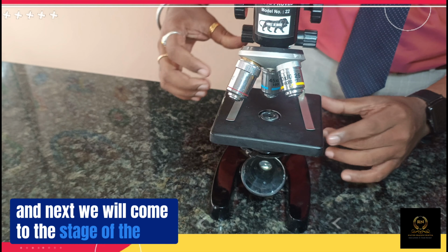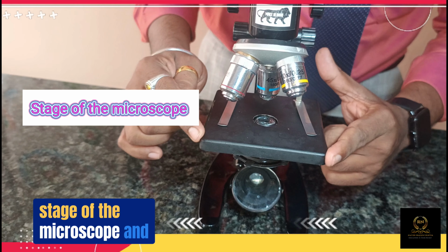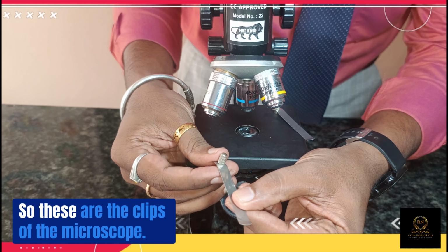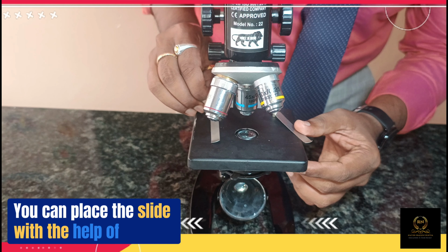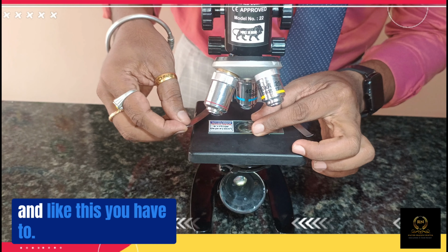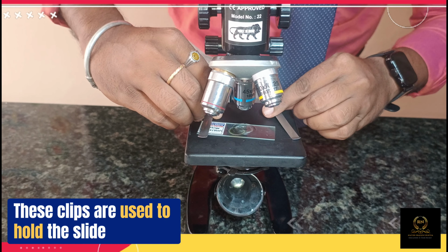And next we'll come to the stage of the microscope. From here to here is the complete stage of the microscope. And these two, you can see, these are the clips of the microscope. You can place the slide with the help of these clips. I'll show you. This is your slide, for example, and like this you place the clips. These clips are used to hold the slide.